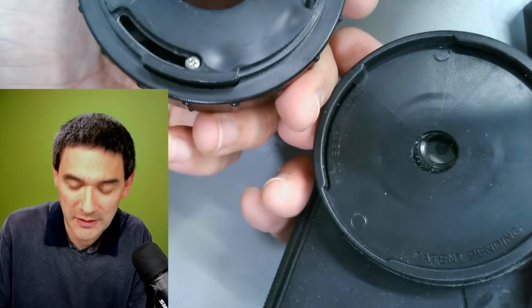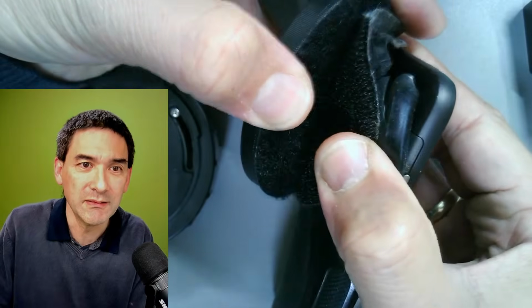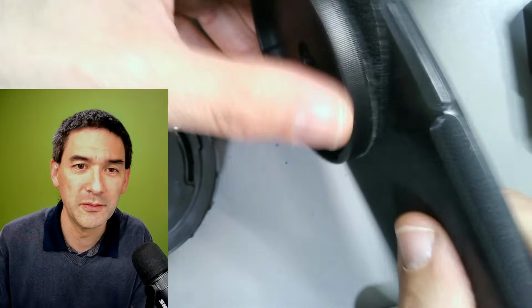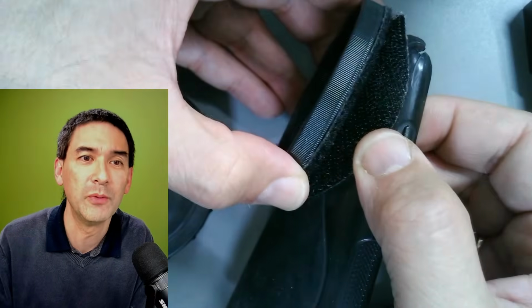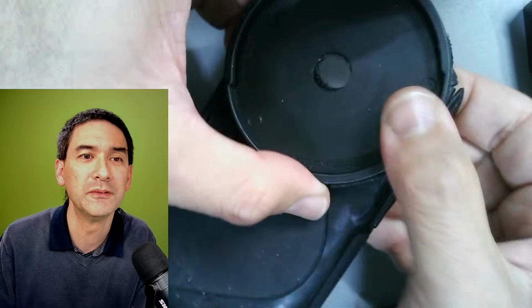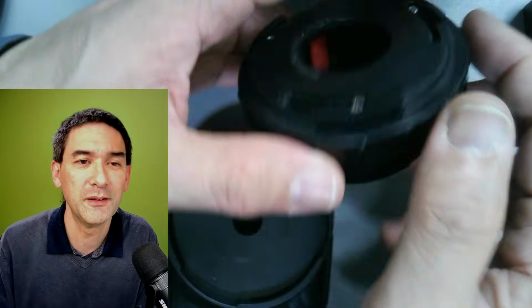This is how it looks. And this here is actually connected, using a Velcro, to a mobile phone case. So basically, there you could stick it on here. So this here is connected over Velcro, right? And over here, this is the actual adapter.